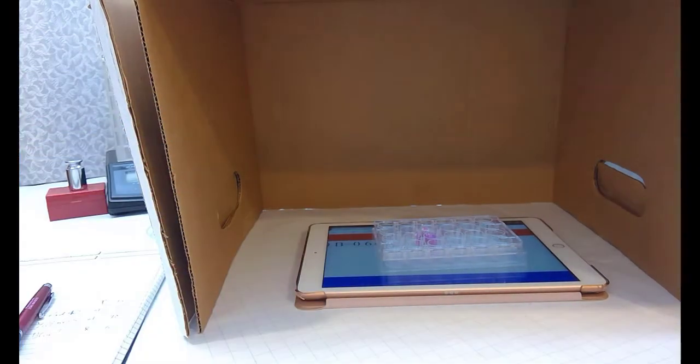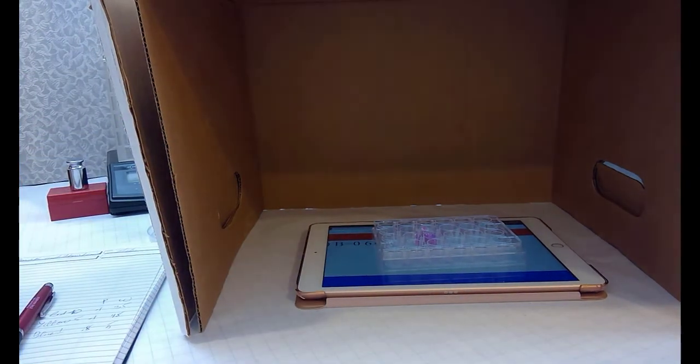So my next step is to take that photo with only the bottom lighting, and then we're going to analyze that data and find out what really is going on as red, green, and blue light goes through phenolphthalein. And we'll discuss the absorption values that occur with each. So that's our next step. I'm going to get this in the dark, and I'm going to take a series of photos.